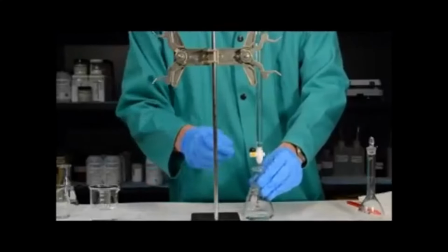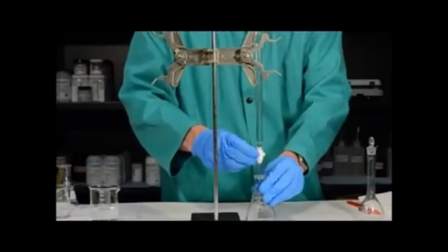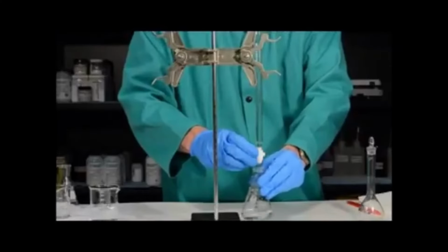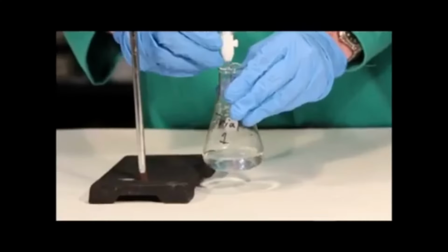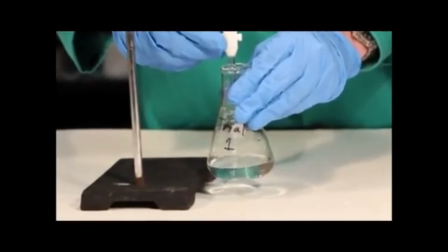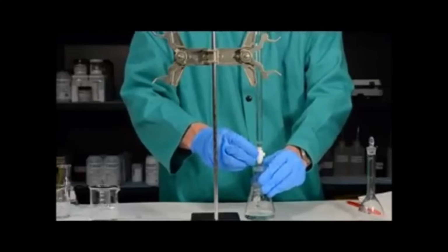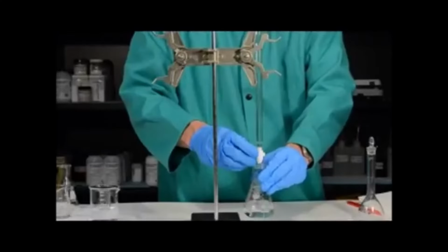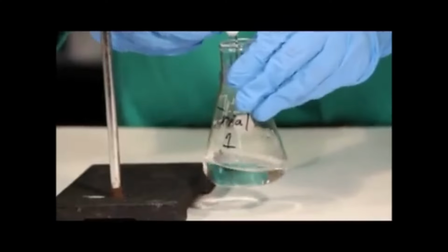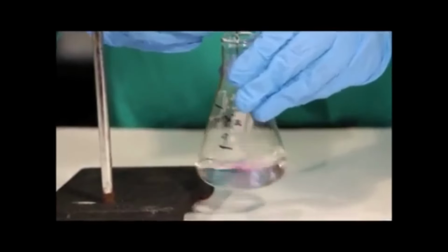So I need to swirl the flask and control the stopcock at the same time. I want to begin by slowly adding some of the base from the burette into the Erlenmeyer flask while swirling. You'll notice that if I stop swirling for a second, you can actually see some pink color in the flask. This is a good way to know that you've added some indicator. I then want to continue the titration in such a way that I'm adding more and more base, and you'll notice that the pink color begins to persist longer and longer as I reach the end point of the titration.